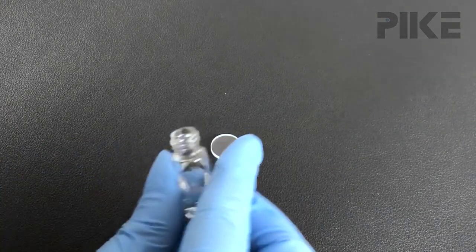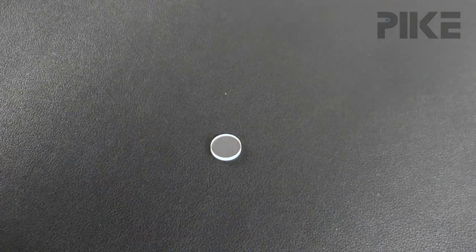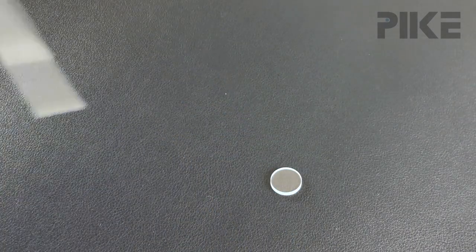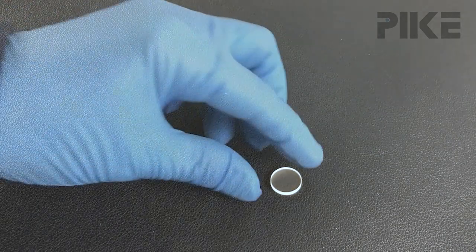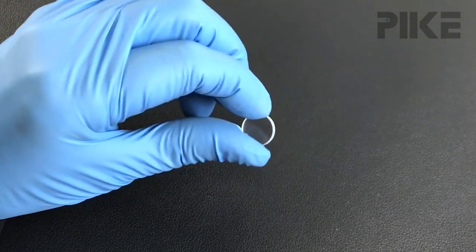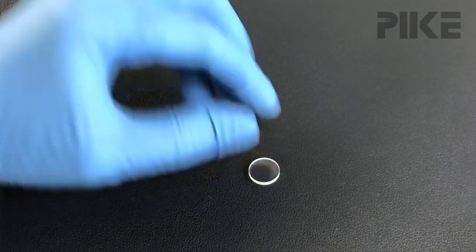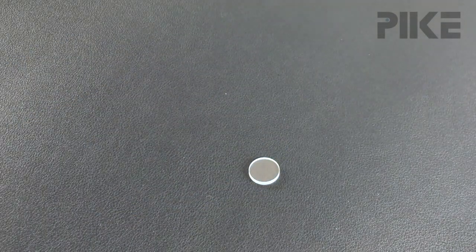Step three, once your sample is dissolved, take a drop and pipette it onto the window and let the solvent evaporate off. And now you're ready to make an IR transmission measurement on your newly created film.